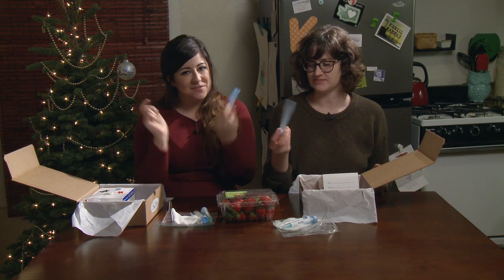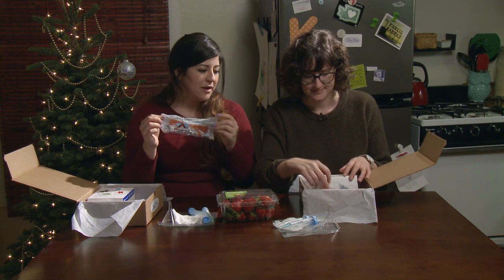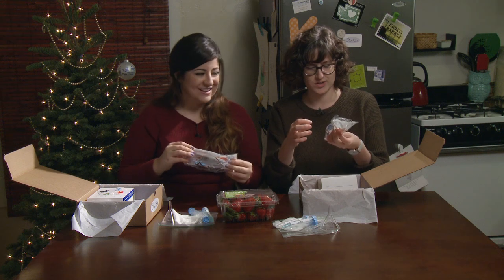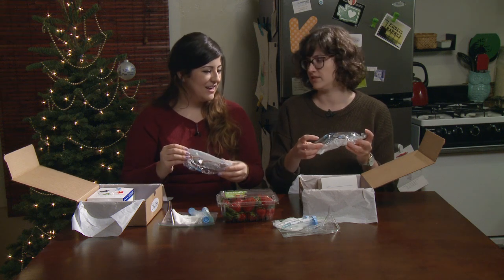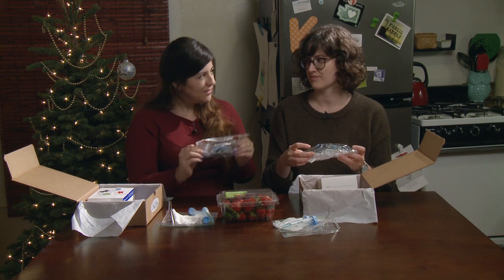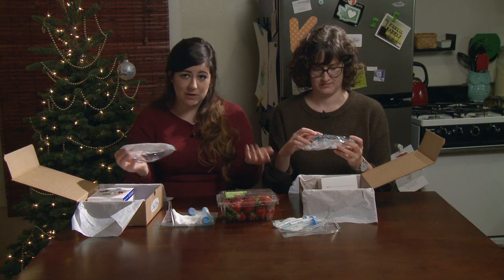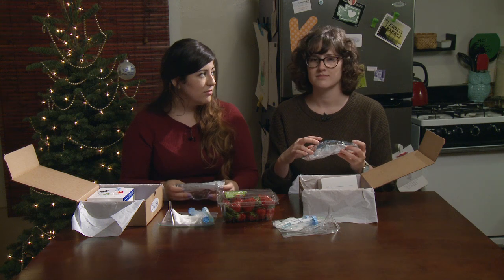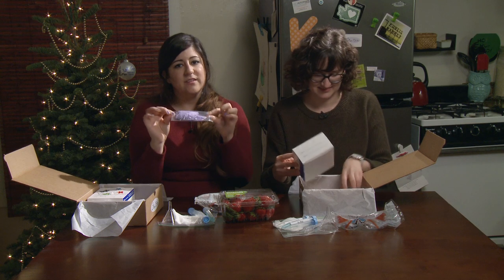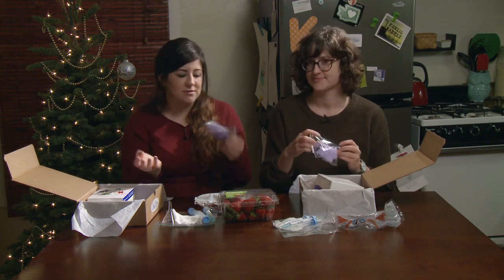We have an empty 15 mil conical tube — you're gonna need that. We have safety goggles. So should I wear these even though I'm wearing glasses? That's up to you. Depending on how well you can see without your glasses, you're encouraged to wear safety glasses, or you can try fitting them over your glasses, or just wear your glasses. We have four safety gloves — these are nitrile, there is no latex in them, so if you have a latex allergy you should be fine.